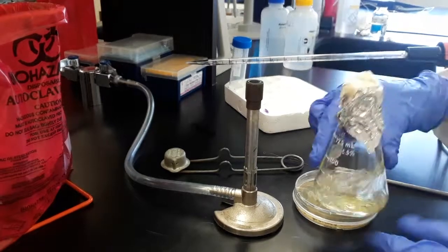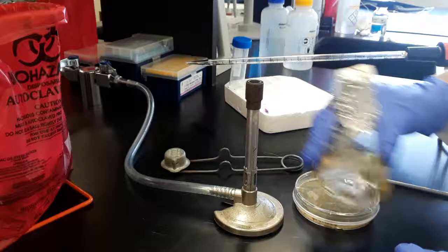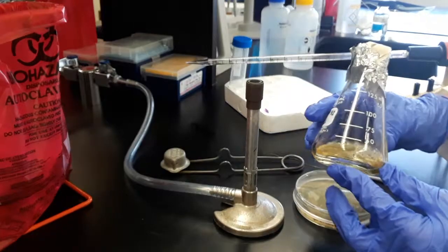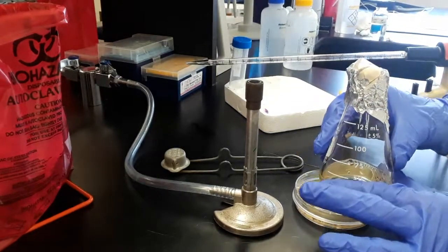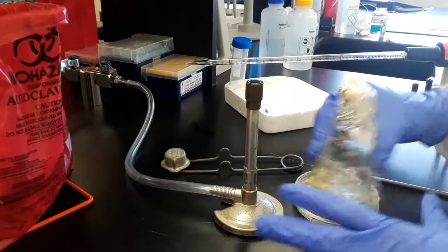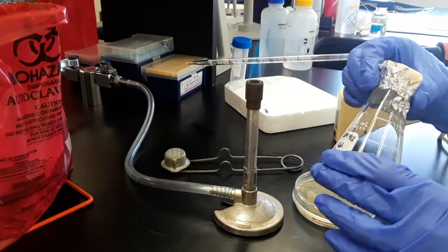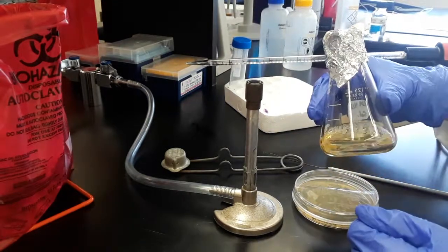We'll put this in a 37 degree incubator to rotate at about 250 RPM overnight. That will give us a stock solution. About 12 mls of this will be used to inoculate 120 mls tomorrow during the day. And that's how we make protein in bacteria.